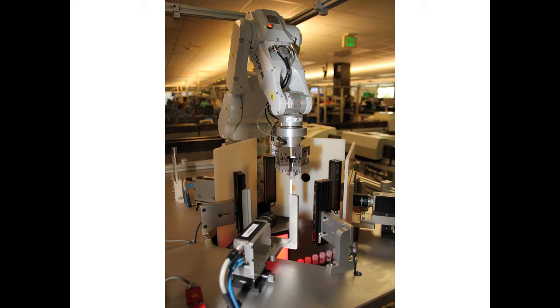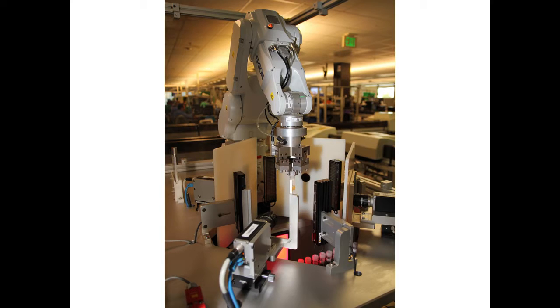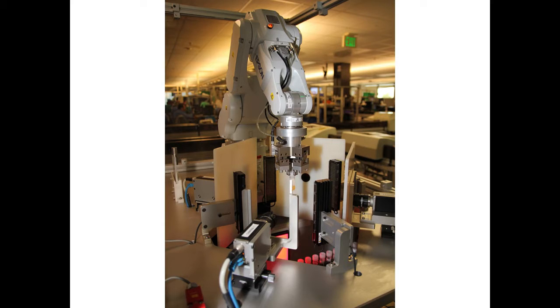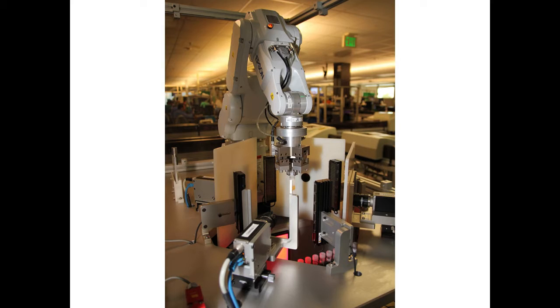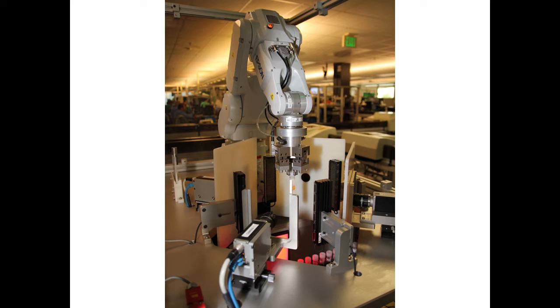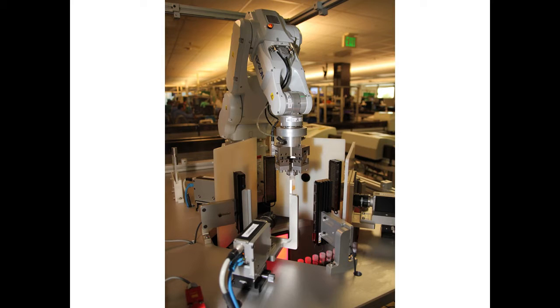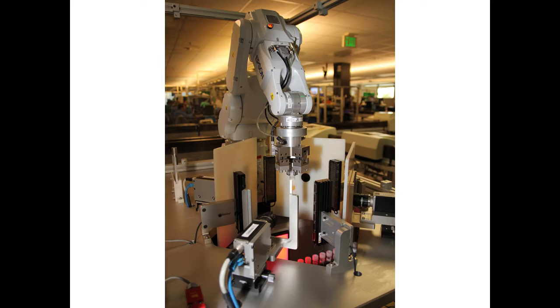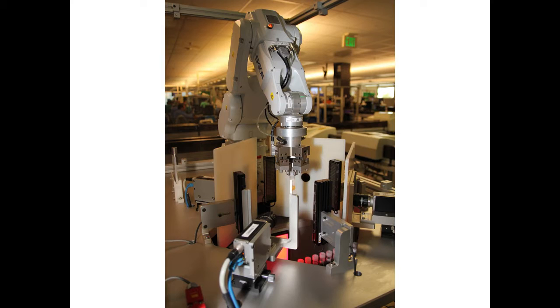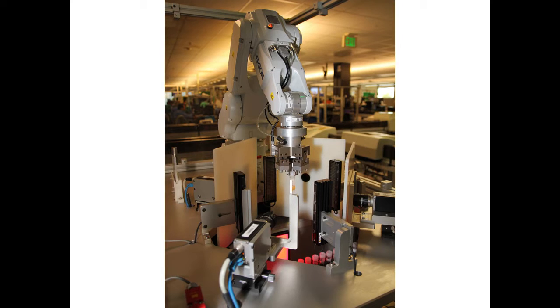ARUP is very proud of this invention of an automated system for detection of possible mislabeled specimens. All fail images are not necessarily mislabeled — images can fail because of poor quality client labels or other reasons. However, when multiple OCR systems are fully implemented on our automation, all fail images will route to a station where they will be inspected by an employee. Most of these will be found to be correctly labeled, even though the OCR system could not declare them as passes. The few that are found at this station to be mislabeled will be promptly investigated and relabeled.